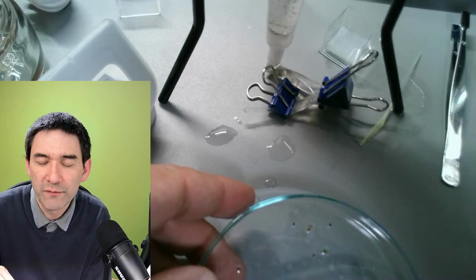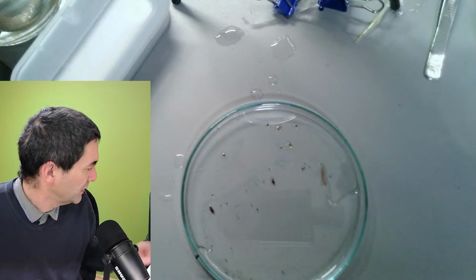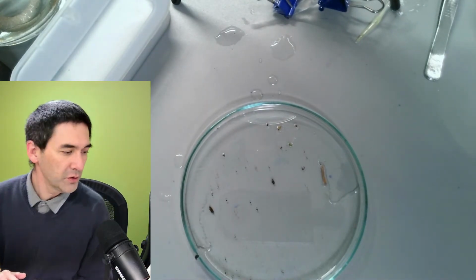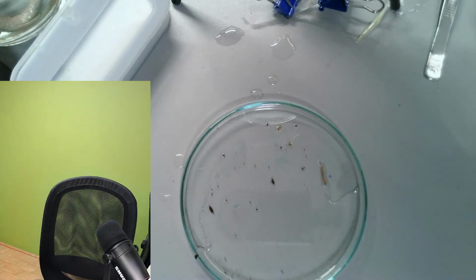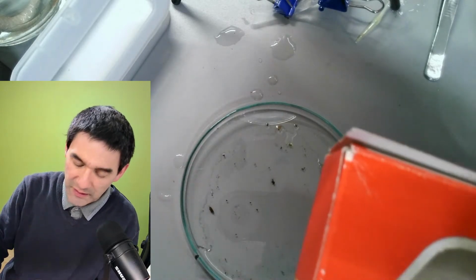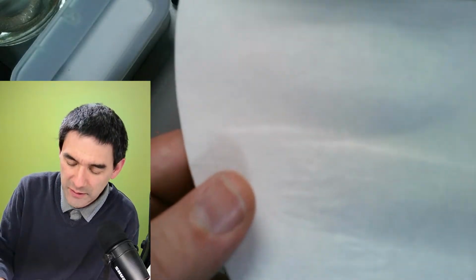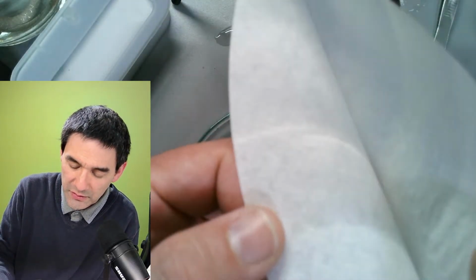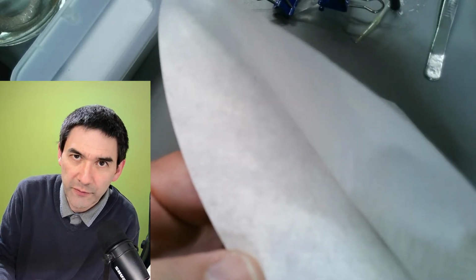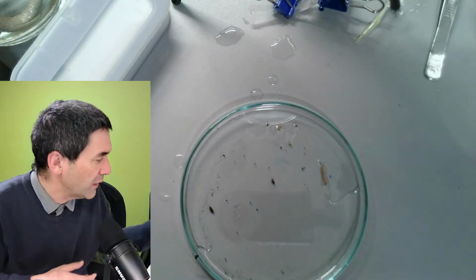Why can't we just use a funnel with a filter? Well, if you use a filter, I'm just going to show you the following. Where is my filter? Just a second. Yeah, here. Look, if you want to use filters, like coffee filters here, then I think they are too dense. So I don't know if the microorganisms or the water bears are actually able to go through the filter. That would be a little bit my concern here, that you're essentially filtering away too much.